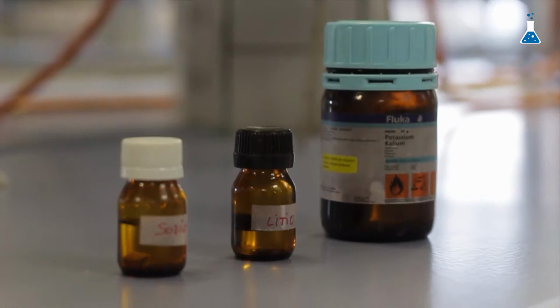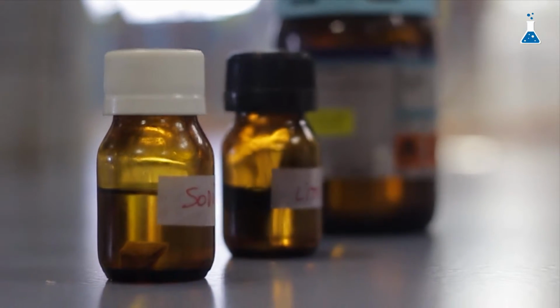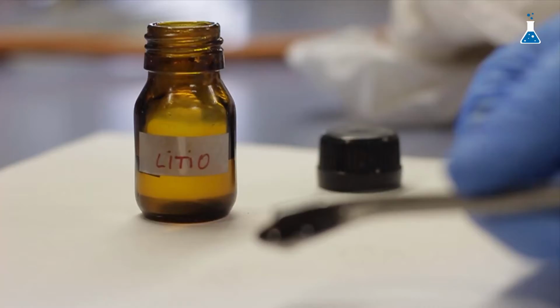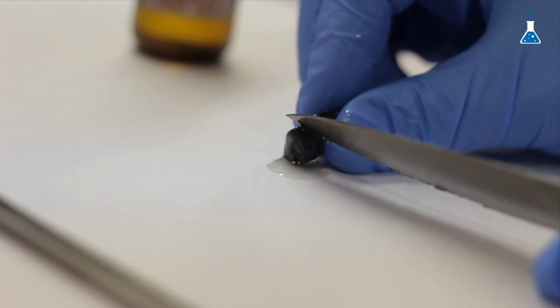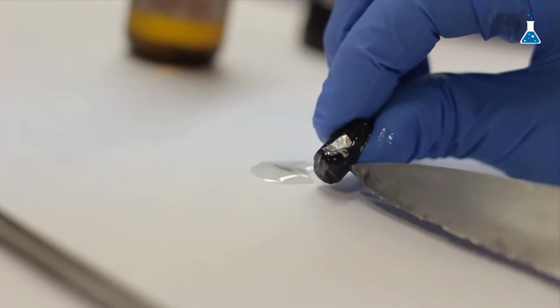Let's examine the reaction of the first three metals in the group: lithium, sodium, and potassium with water. As we can see, all of them are kept in a container with oil in order to prevent oxidation with the atmosphere. Let's start the demonstration with lithium. Lithium, as you can see, has a grayish appearance due to the oxide coating. But if we remove the surface with a knife, we see the silvery shiny appearance of the metal.